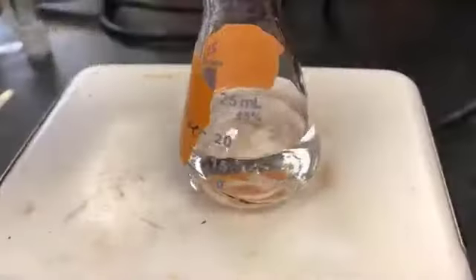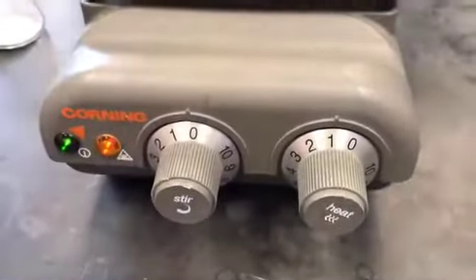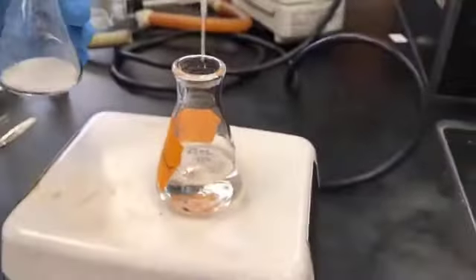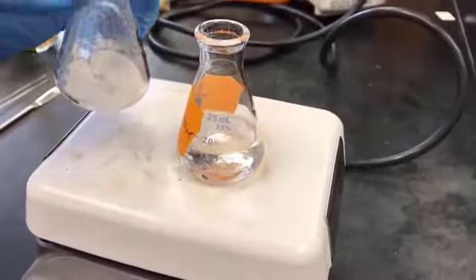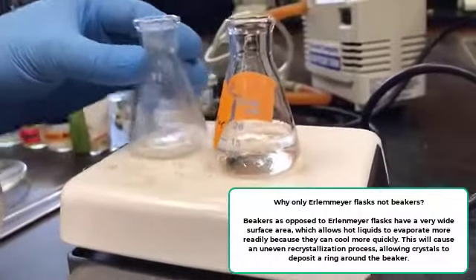Now you can see the solvent is boiling, 95% ethanol, right? So this is boiling, so I just lower the heat here, otherwise there will be unnecessary boiling and we would be losing the solvent unnecessarily, right? So now I will barely cover the crystals with the boiling solvent. And I will try to swirl it.